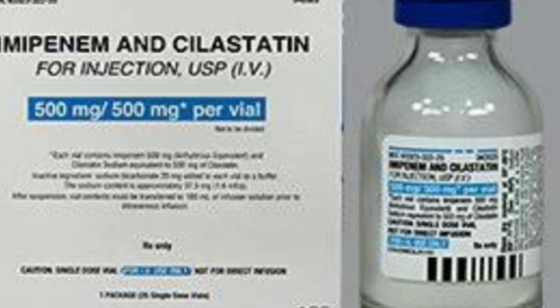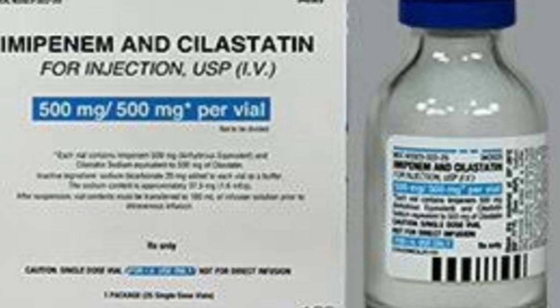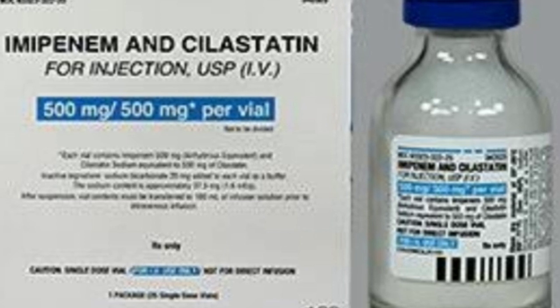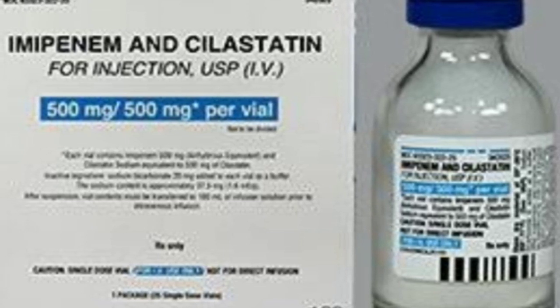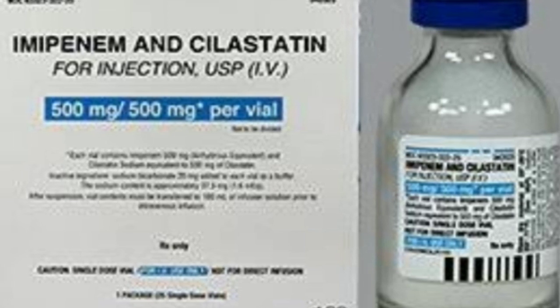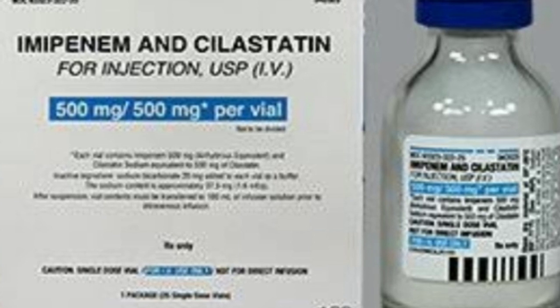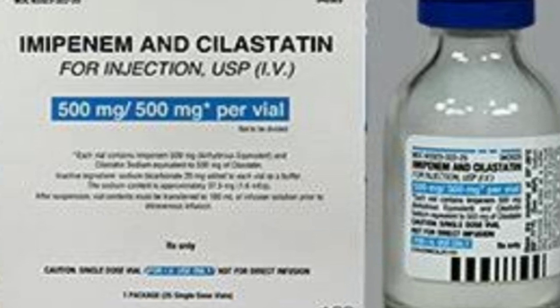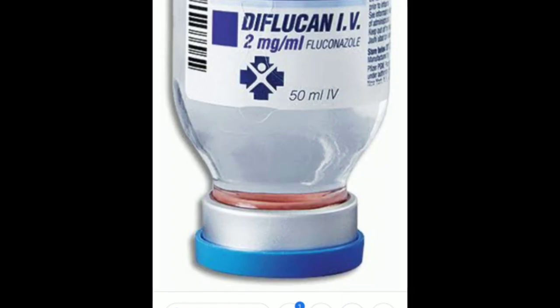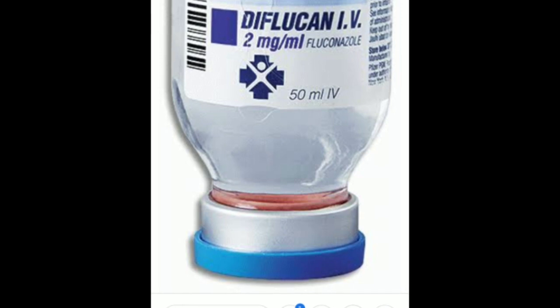That solution is ready for topical use. That covers the antibiotic fortified drops. Now for antifungals — fluconazole is the antifungal that comes in injection form at 100 mg per 50 ml, or 2 mg per ml, which can also be used in the same concentration for topical use. Simply draw the solution from the injection vial with a syringe and put it into an empty bottle for eye use.